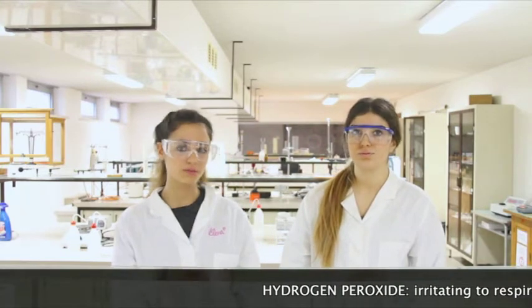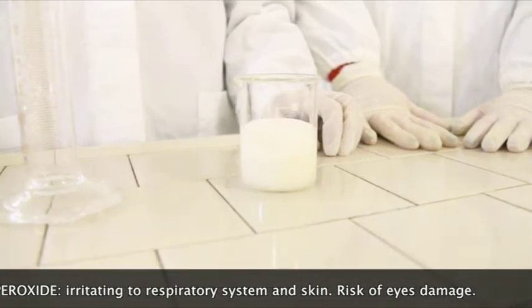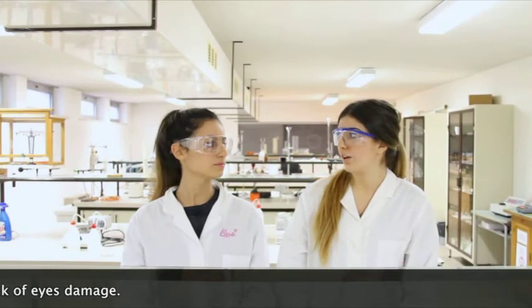Today we're going to see different experiments. Let's have a look. Look, there are a lot of bubbles. What did you use? Just some hydrogen peroxide and yeast. Only these two common reagents.